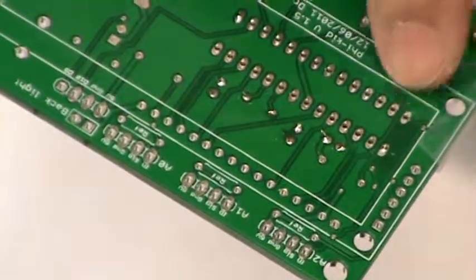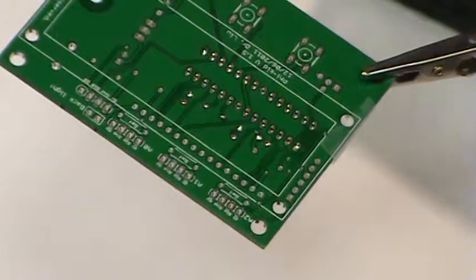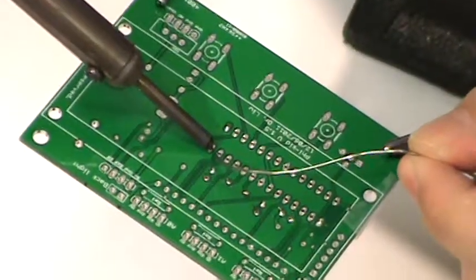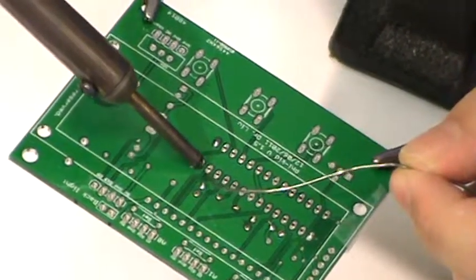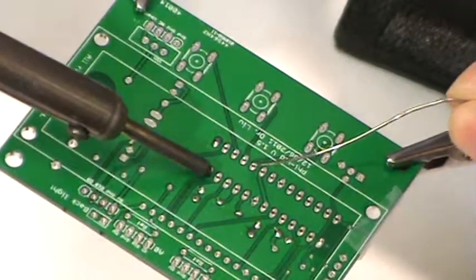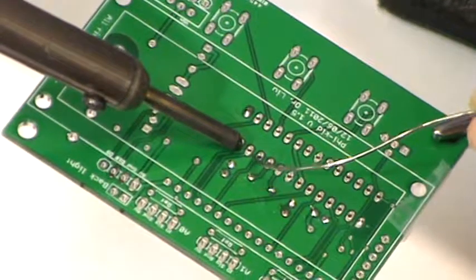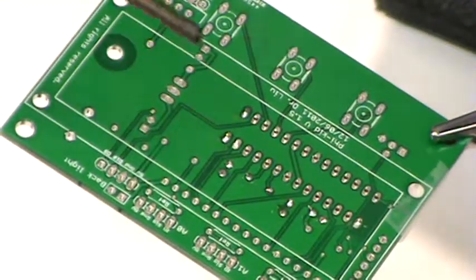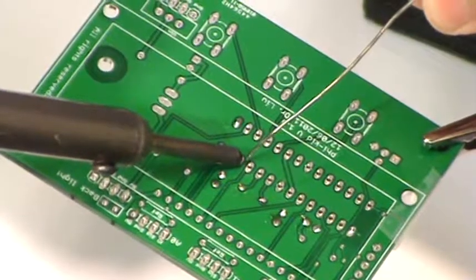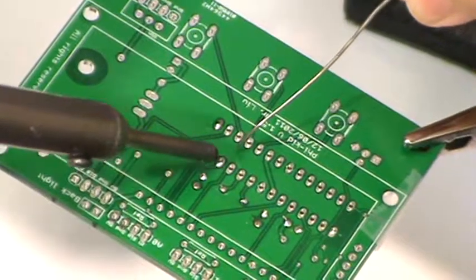Okay, we can trim this a little better after we're all done. So now we'll just go ahead and solder all the pins of the socket. It's best that the solder doesn't touch the iron directly, but it touches the part that's going to be soldered, and if that part is hot enough, it'll melt the solder.